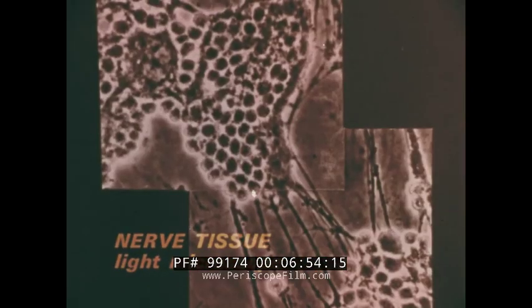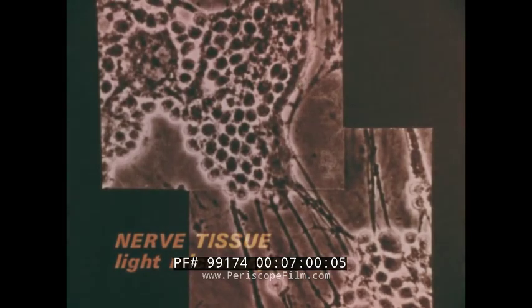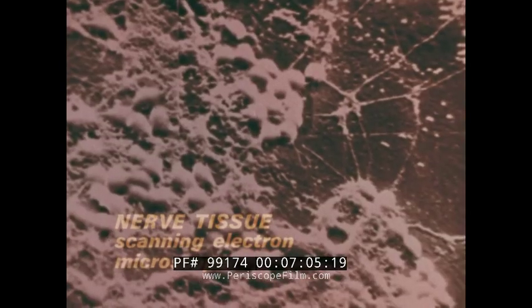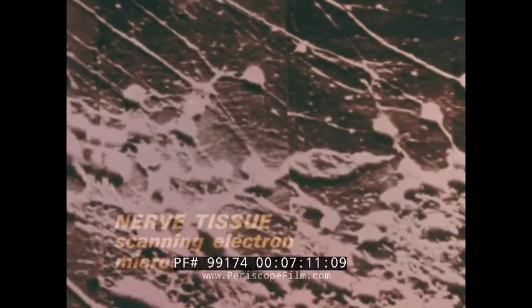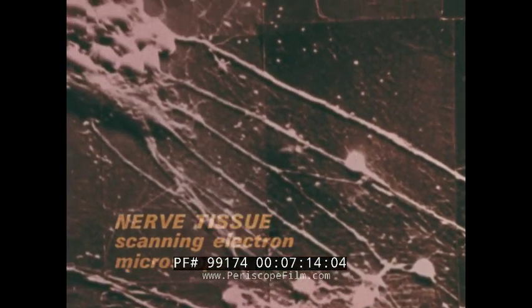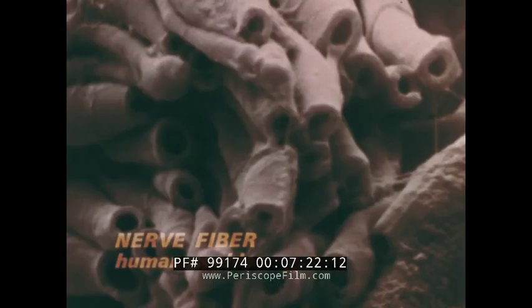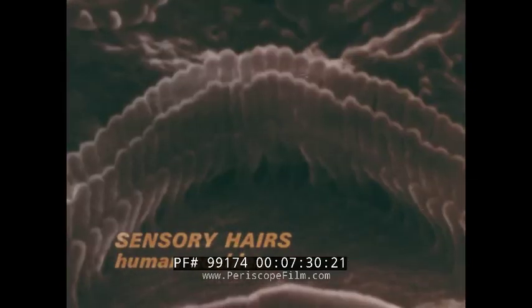For example, a nerve tissue culture appears like this through the light microscope. However, by putting together a mosaic from the scanning microscope, we can see whole sections of the culture in 3 dimensions. The neurons with their long processes, a kind of map in high relief which our minds can immediately grasp and understand. Precisely because we are walkers, touchers, seers in a 3-dimensional environment, the scanning electron microscope gives us Gullivers some insight into the Lilliputian universe.